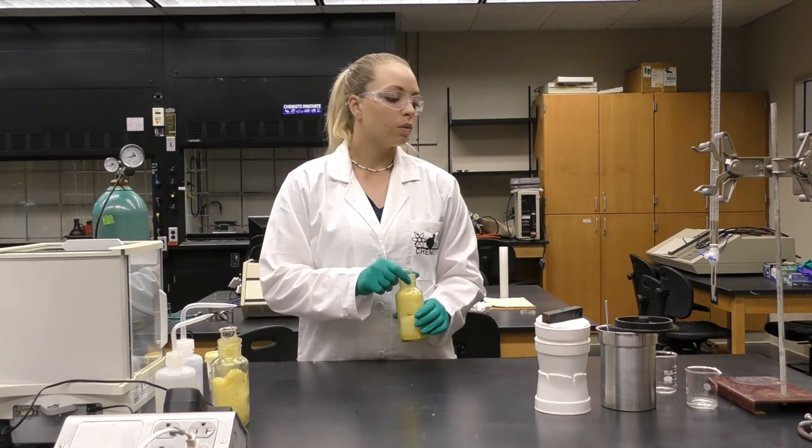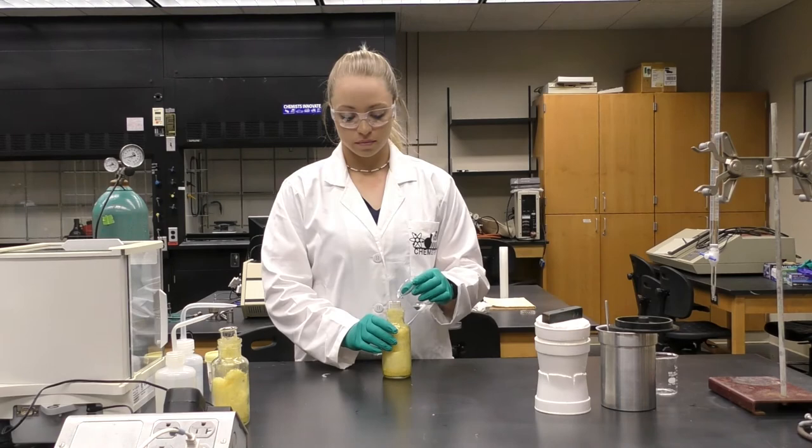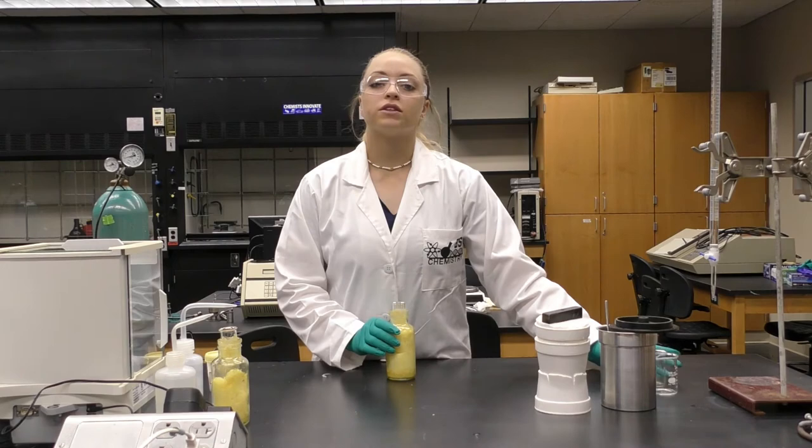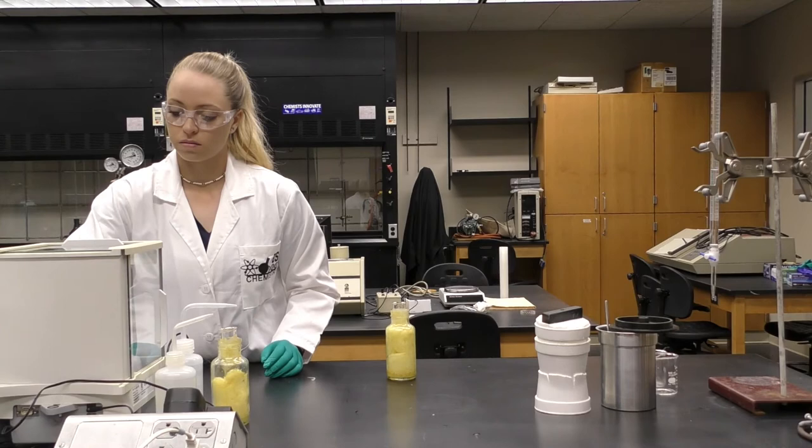For the next trial, we will be using ammonium nitrate. We will need to measure out 10 milliliters of water to put in the calorimeter and we will add 3 grams of ammonium nitrate.